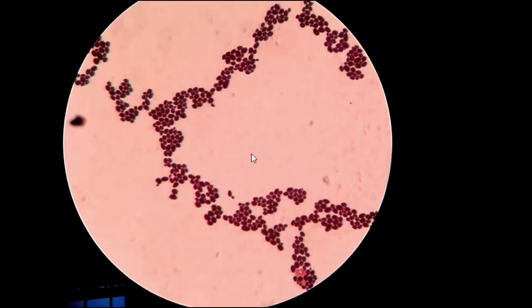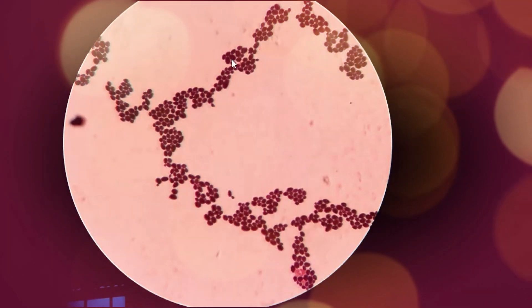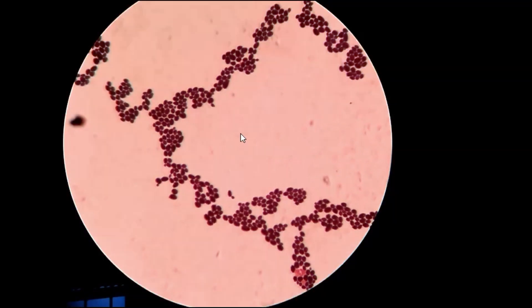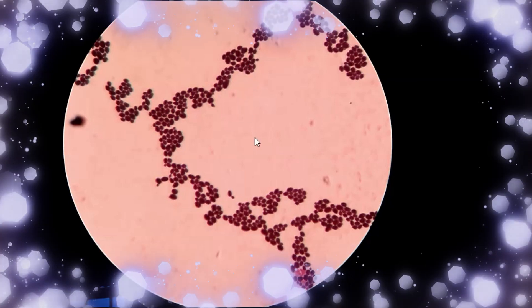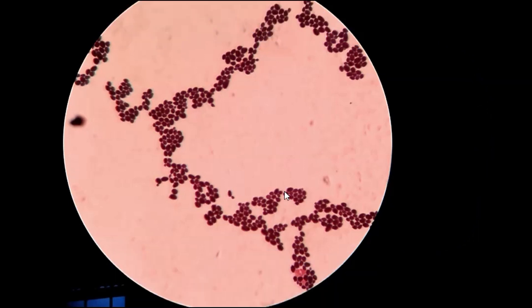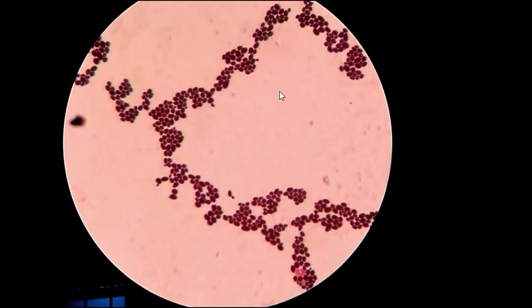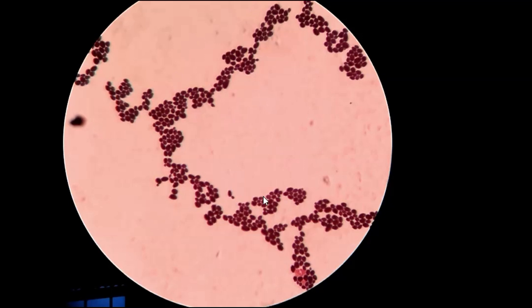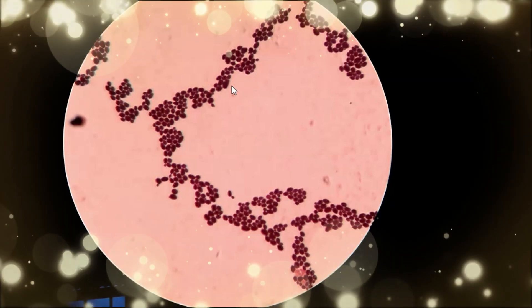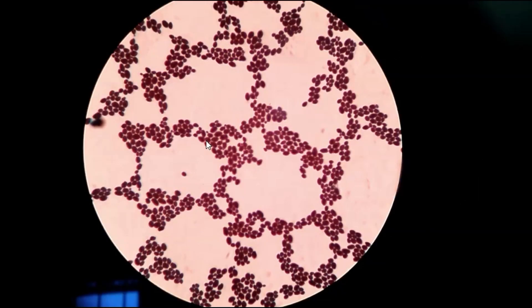Here we can see yeast cells of Candida, which are a thousand times greater than their actual size. The eyepiece is 10x and the objective is 100x, so the magnification is 1000x. Yeast cells are gram-positive.